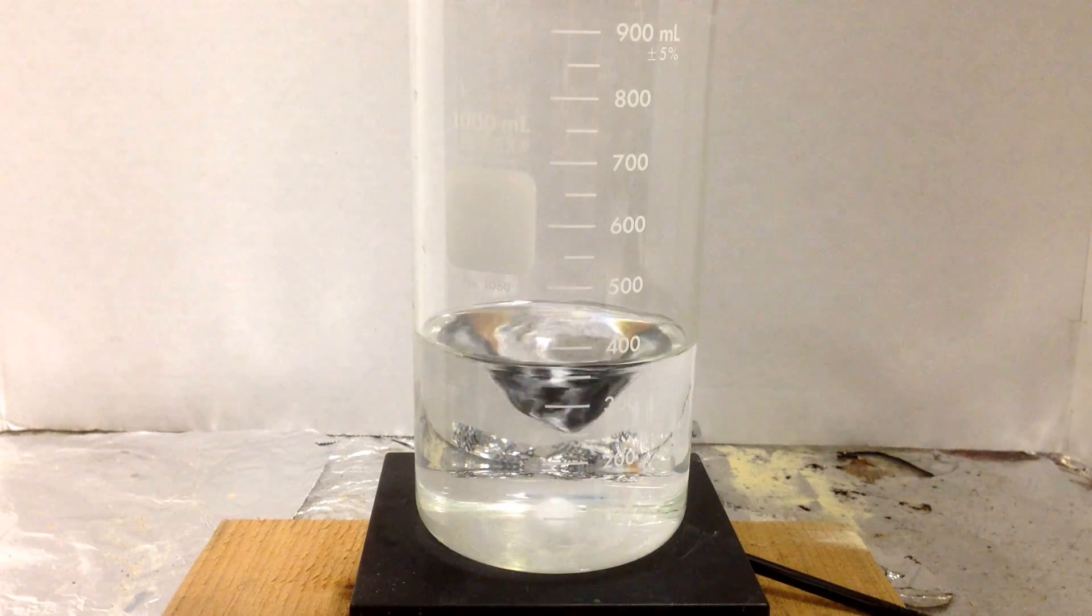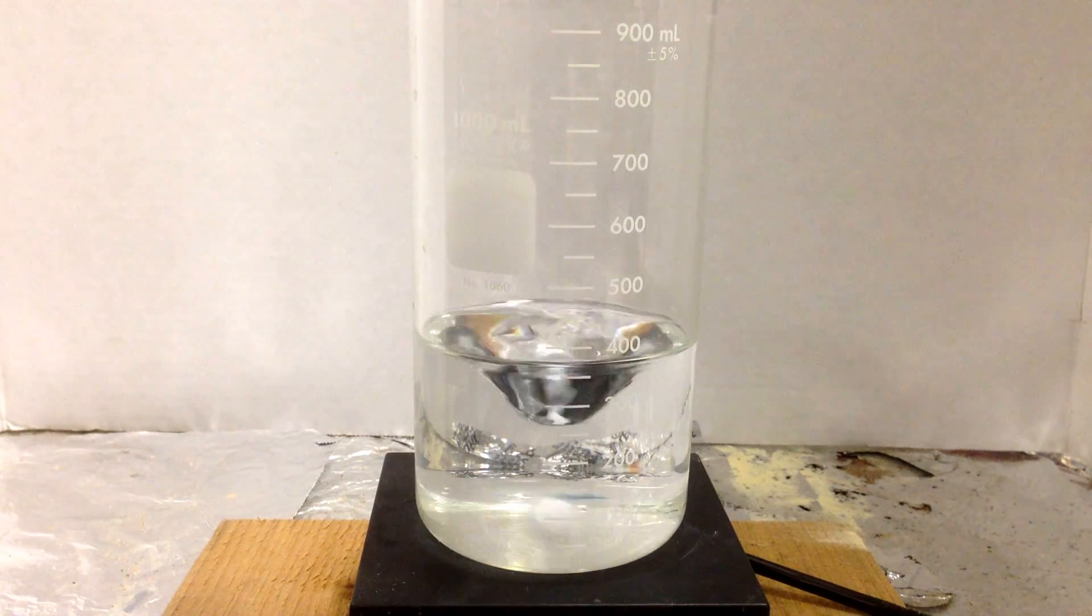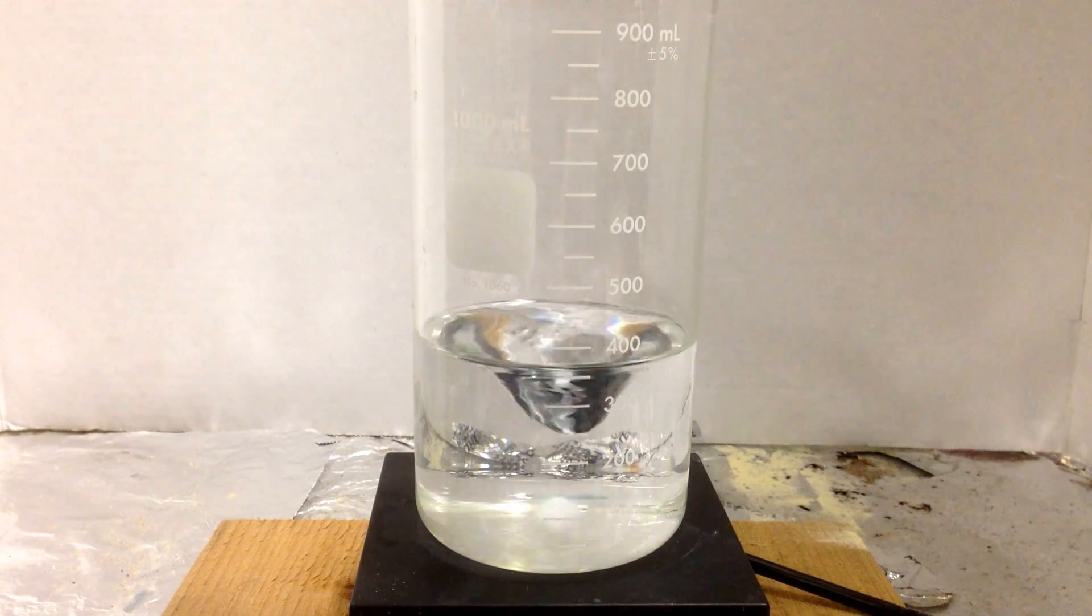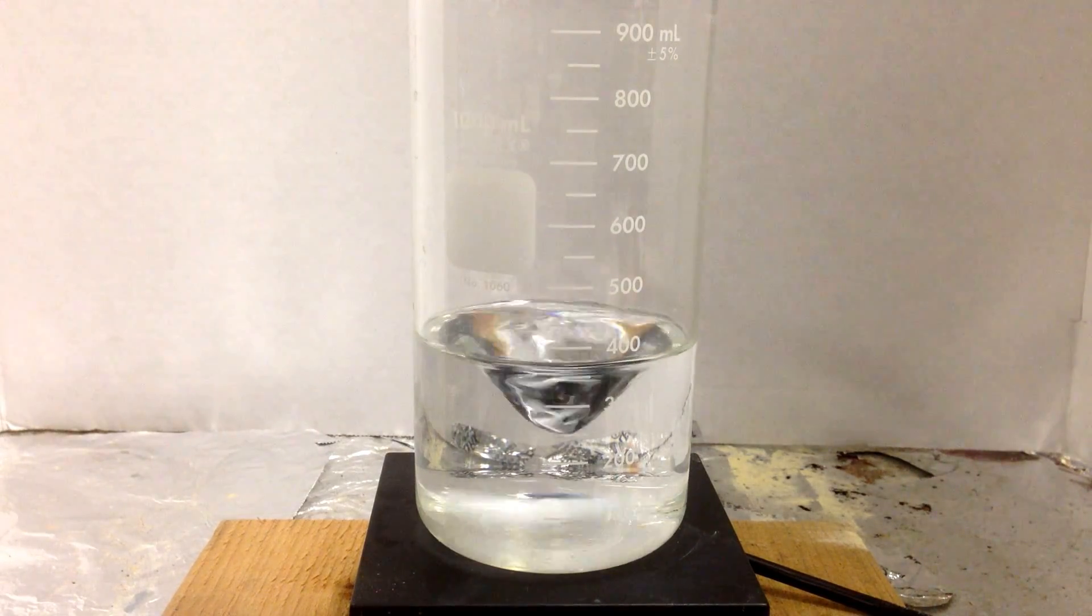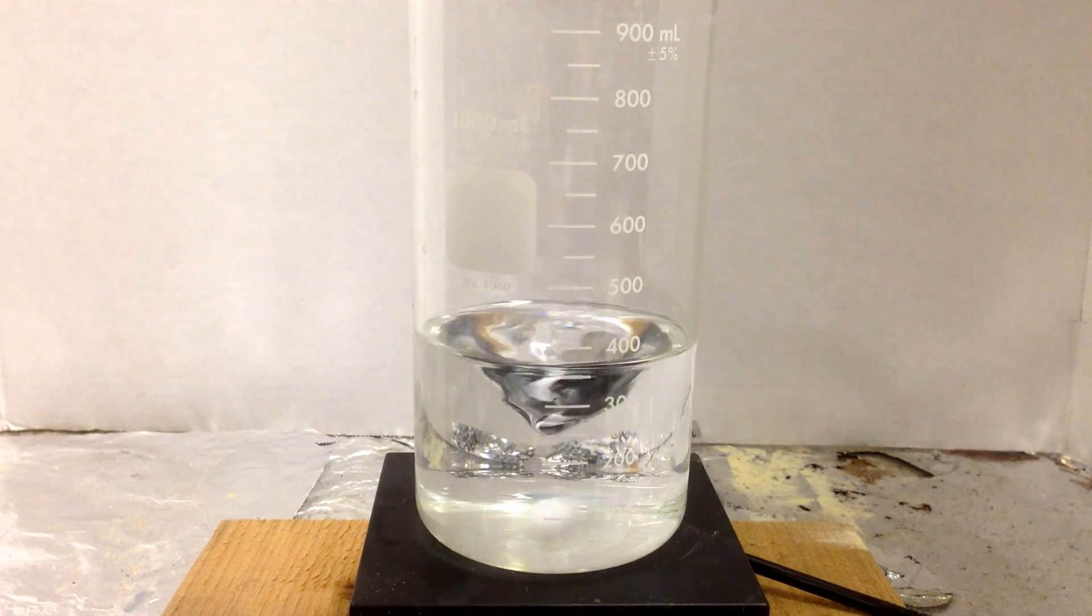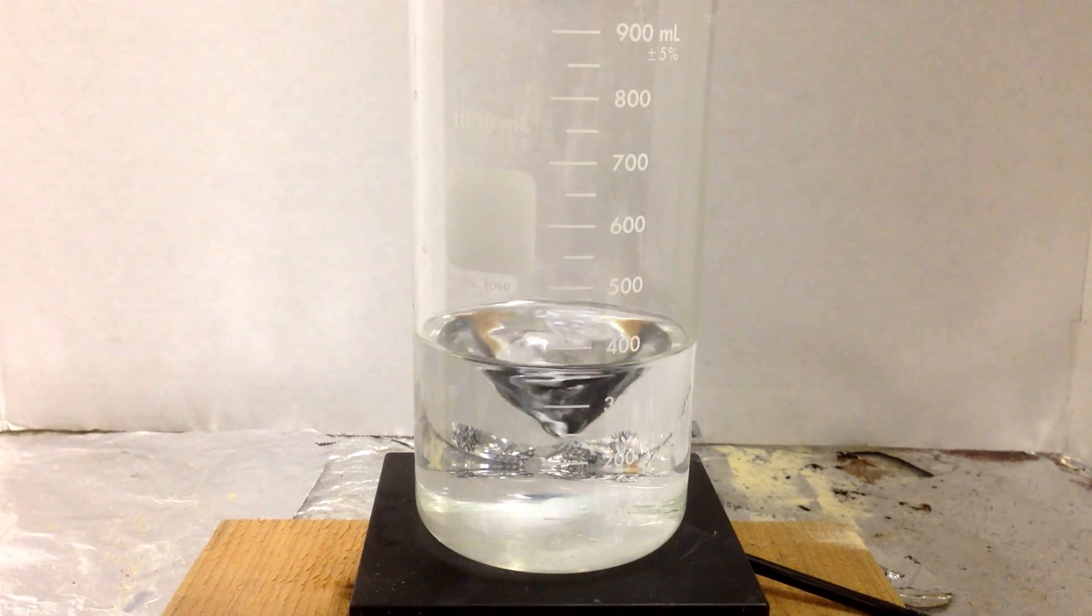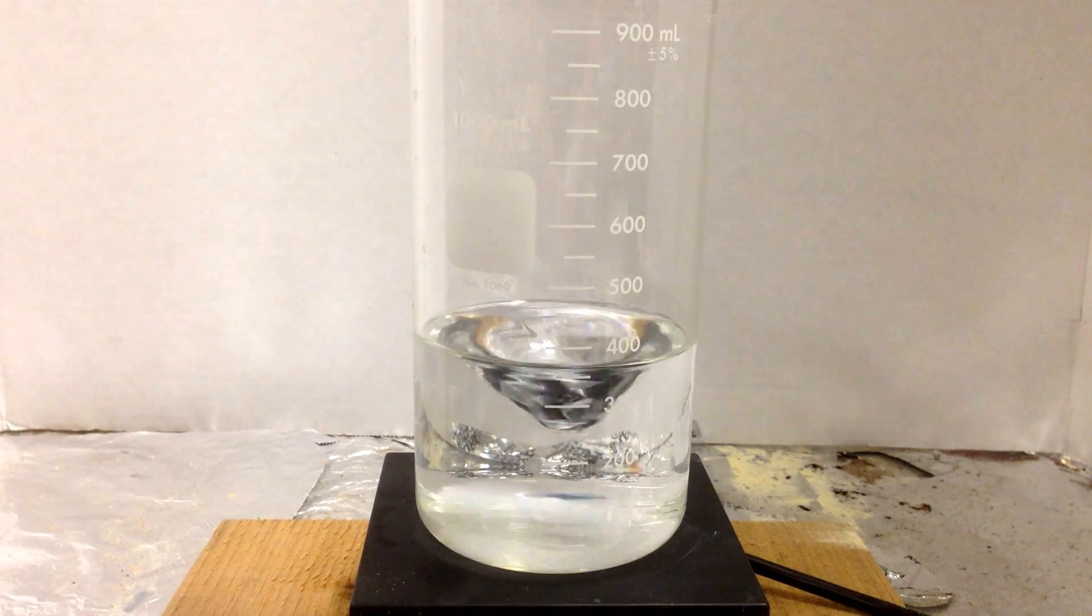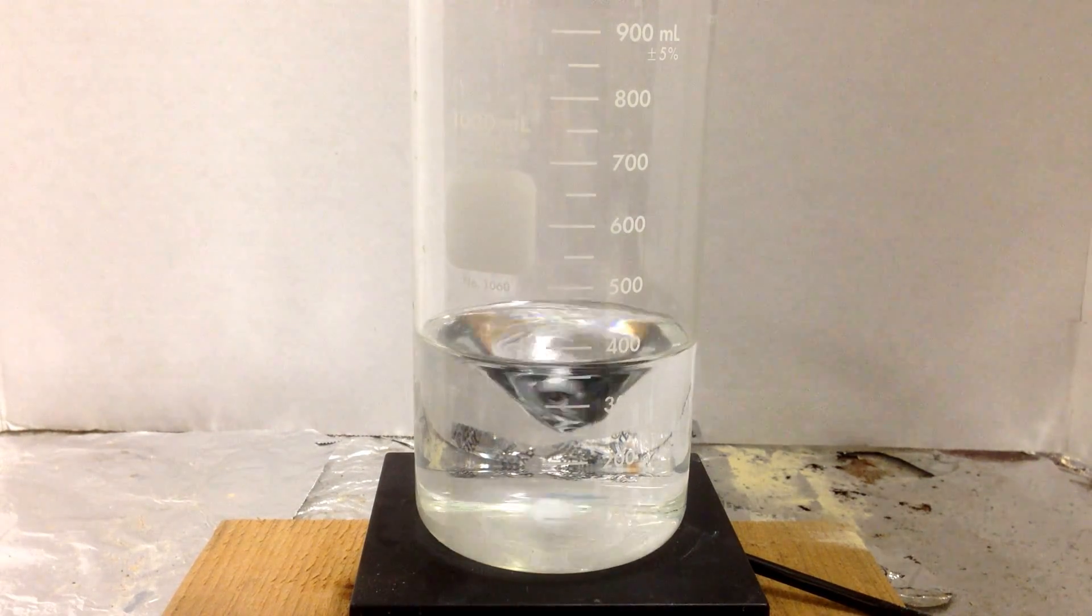Because they're so small and their electron density is so great, they tend to draw in electrons and make complex ions. Before we get started, I'm going to show you what I'm talking about. I'm going to take some aluminum nitrate and dissolve it first in this beaker.